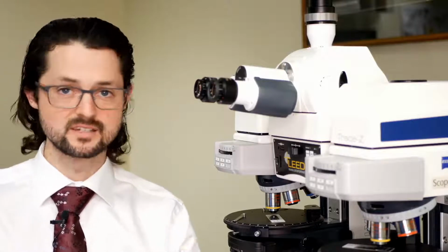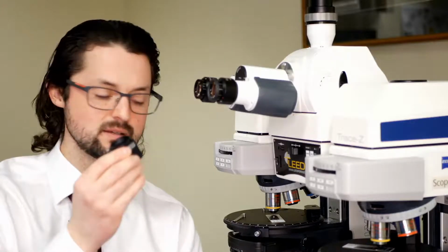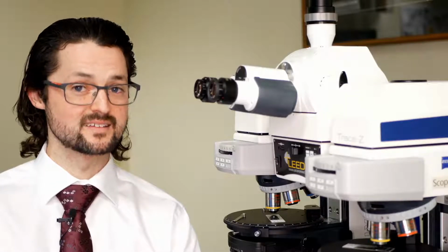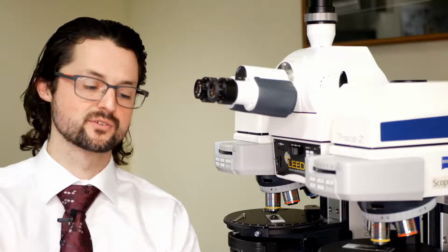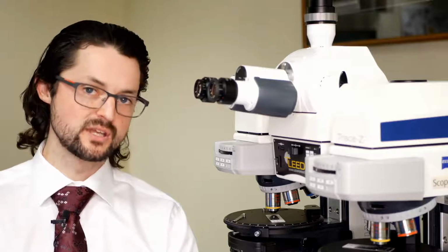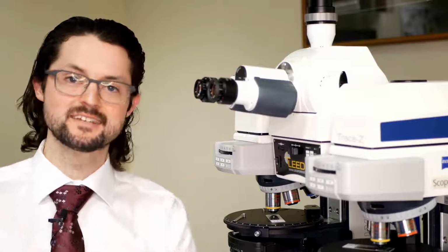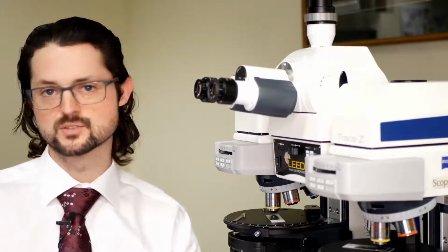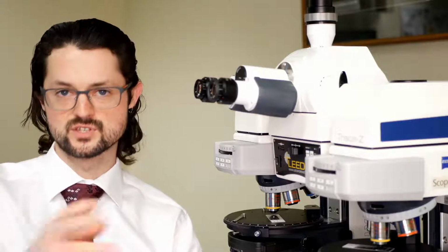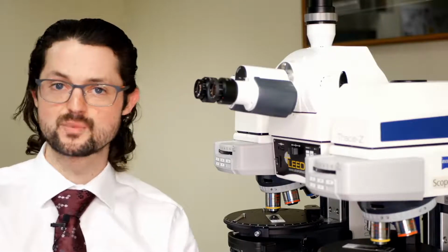But today's live stream, basically, reflected light Brightfield and reflected light pole, is that we have easily implemented systems. If you're looking at a new comparison scope, it's not as expensive as you might think to add a whole other layer of technique to your microscope. And if you already have one of our microscopes, most of the time you can field retrofit and add this technique to what you already have. And then you just have more techniques that you can compare your samples with. Again, like I said, this was a short video today. We might revisit this topic with some samples, with the setup, along with some other types of samples that we've seen from our customers, and have a different live stream on that.